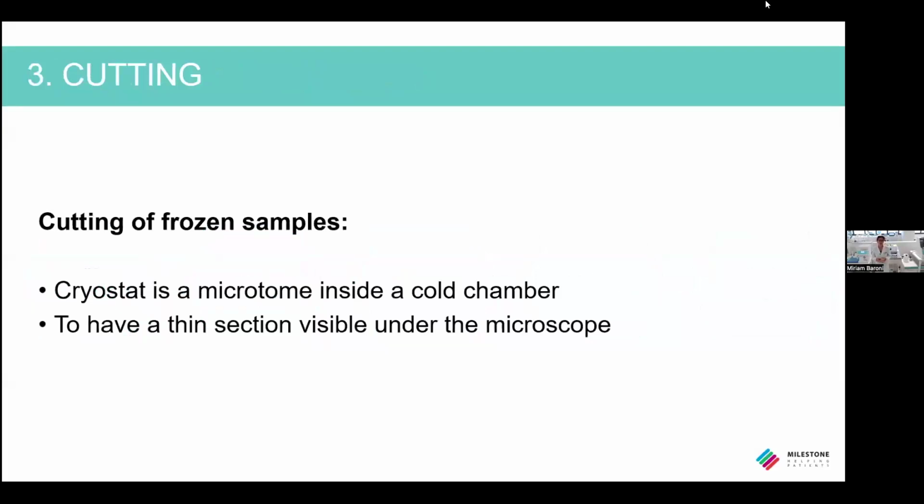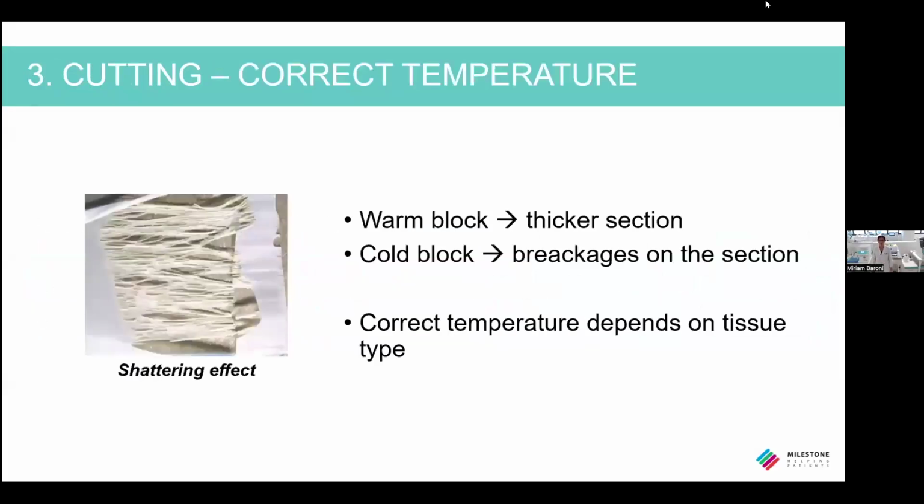The cryostat is the core instrument in the frozen section procedure. It is a microtome inside a cold chamber, so it allows to cut a thin section of the sample while keeping it frozen. Cutting is usually influenced by two factors. The first one is the temperature of the block. If the block is too warm, the section will be too thick and so not good to see under the microscope. While if it is too cold, the block will be more fragile and the section will break, giving the shattering effect that you can see in this image.